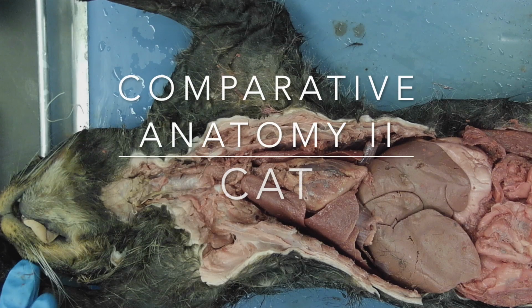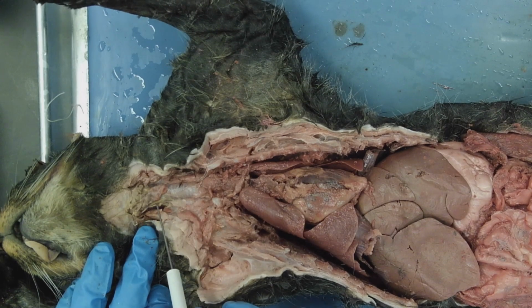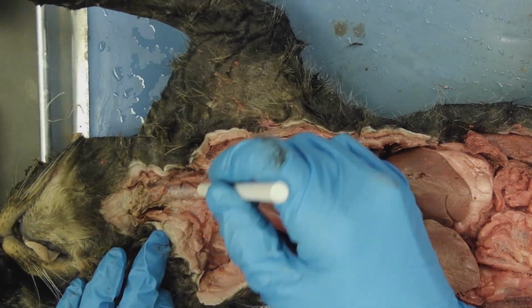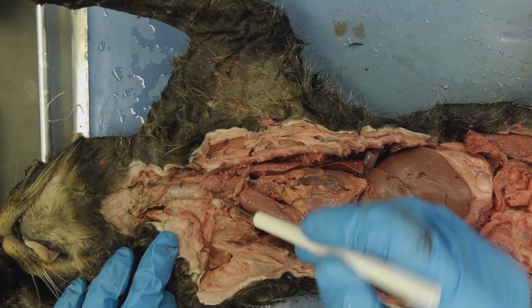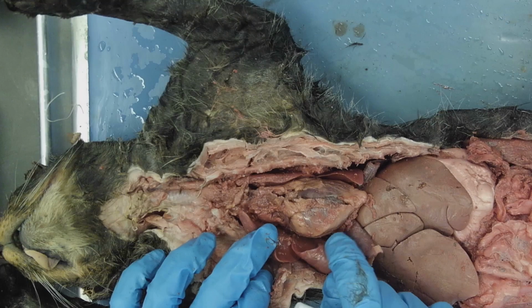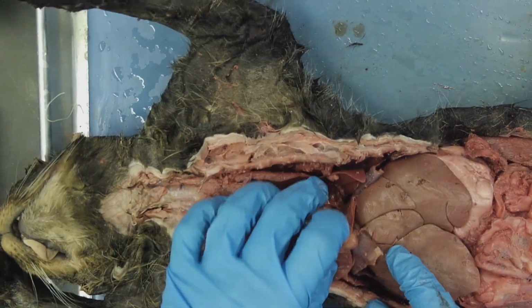Comparative Anatomy II, the dissection of the cat, again focusing on the digestive system. So here I point out the trachea or the windpipe, and then right next to it we can find the esophagus, which then goes down back behind. Here we have the lungs and the heart, and it goes down through.